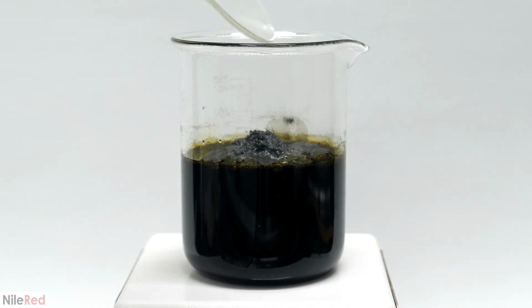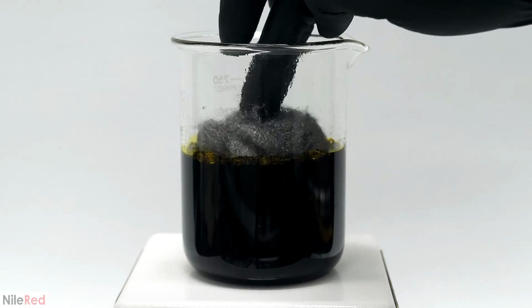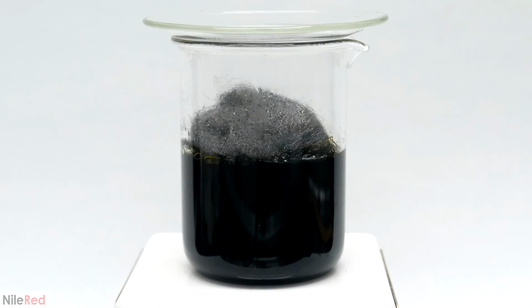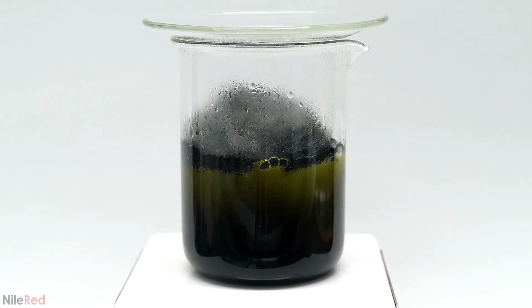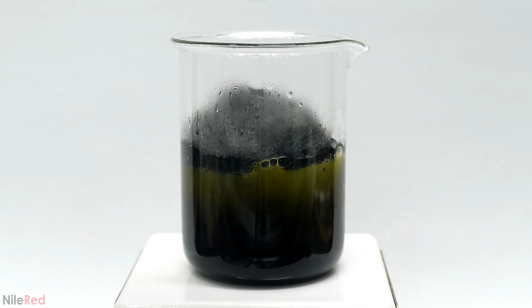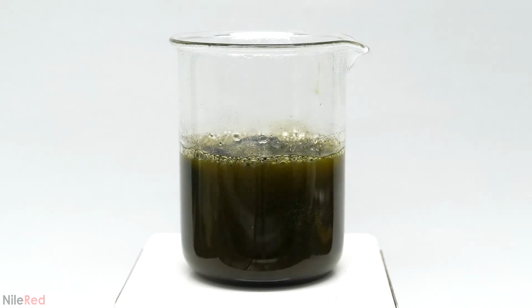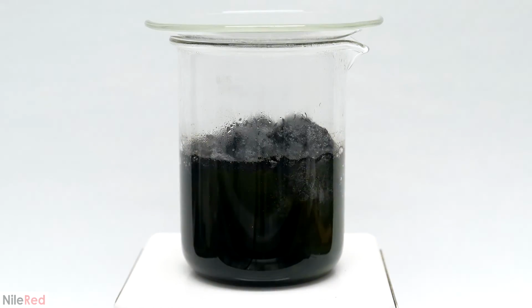The basic idea here was to keep adding the wool until it pretty much stopped reacting, and then to just let it sit there for a bit. I came back about 10 minutes later, and now the green color was getting a lot more obvious. All I did was just stir it around, and then I let it sit for something like another 30 minutes.